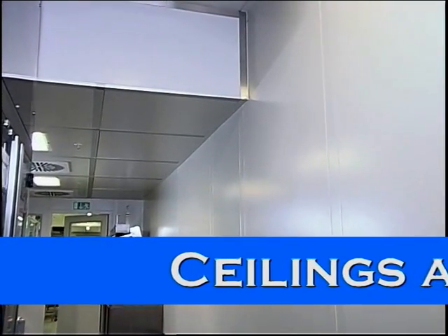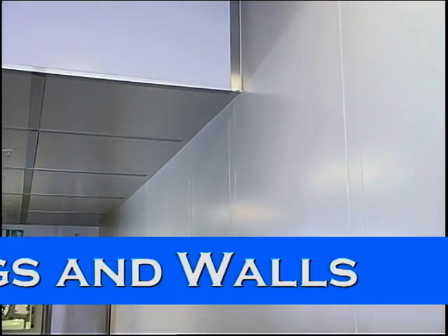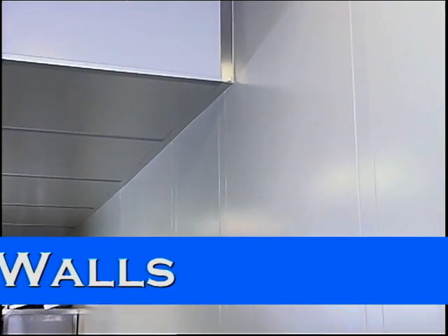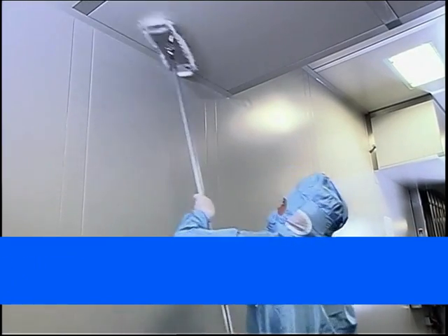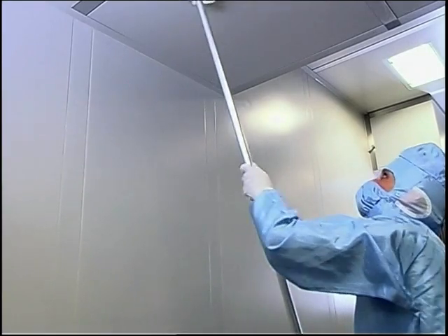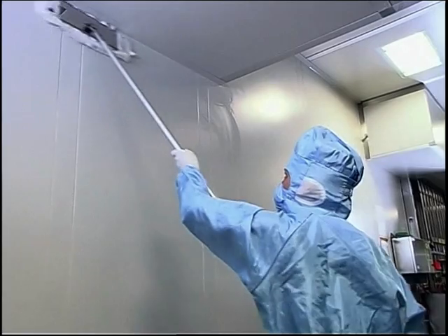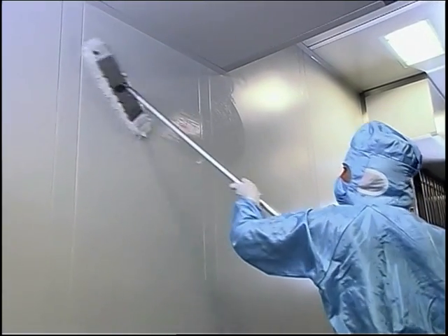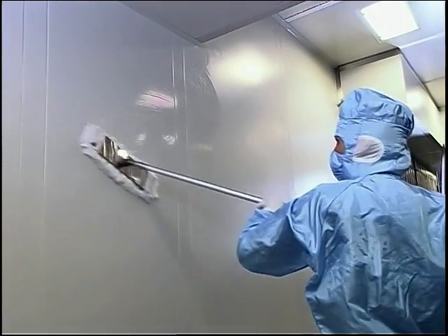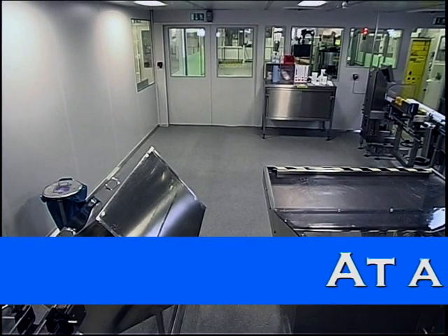The walls and ceilings are disinfected as required, in agreement with the hygiene and/or quality officers. Since the mop handle is light and easy to extend, the cleaning of the walls and ceilings can be carried out using a similar procedure to that used to clean the floor. First, wipe out the corners, then the rest of the surfaces in figure of 8 movements, just like we learned for the floors.